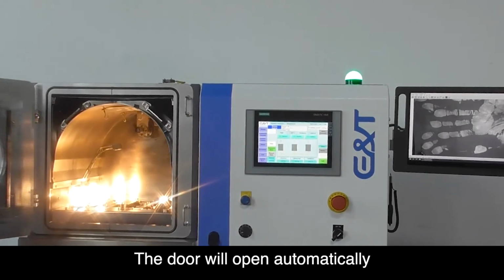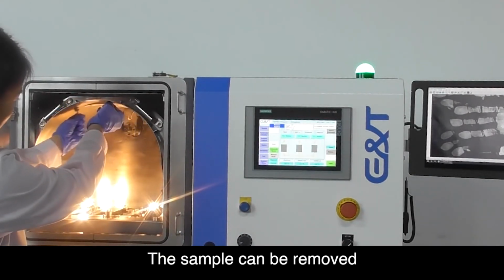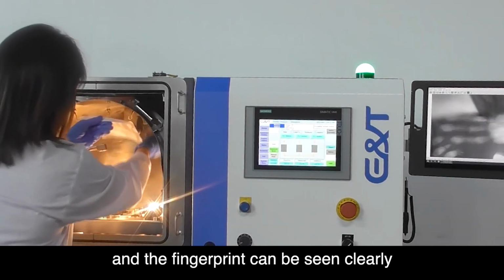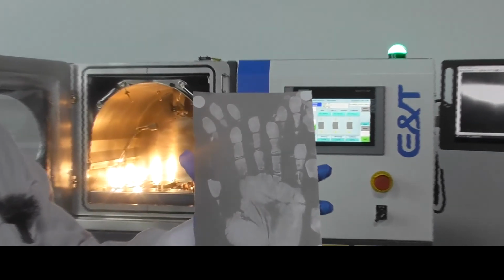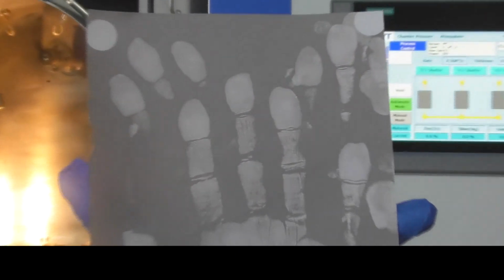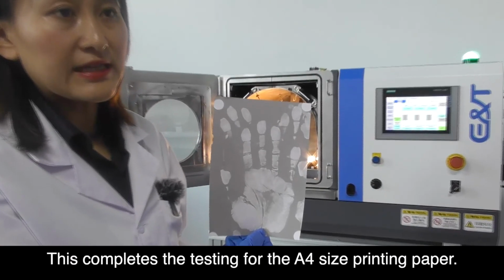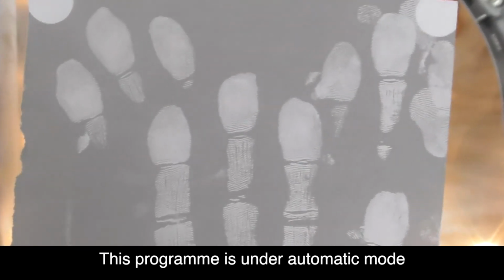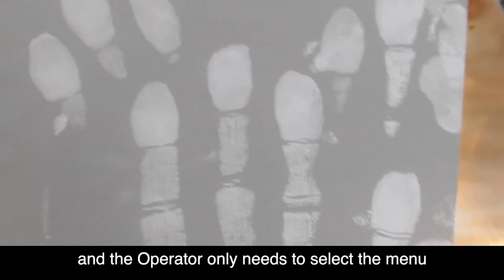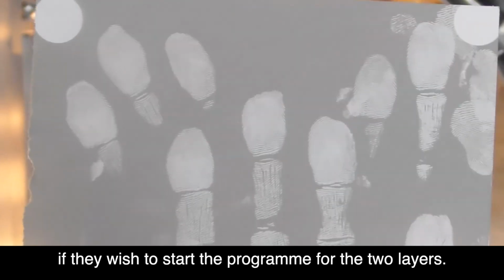The door will open automatically. The sample can be removed and the fingerprint can be seen clearly. This completes the testing for the A4 size printing paper. This program is under automatic mode and the operator only needs to select the menu and press yes if they wish to start the program for the 2 layers.